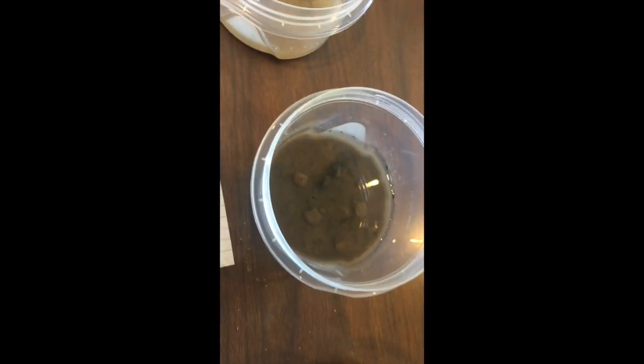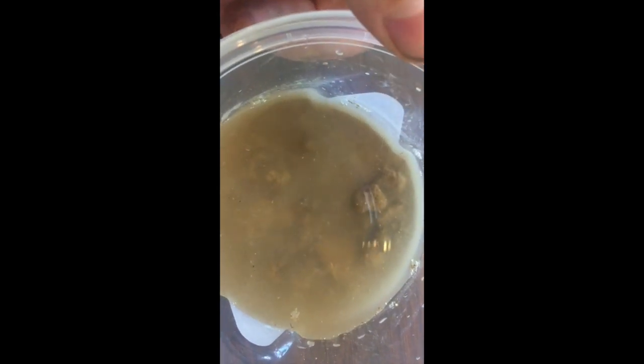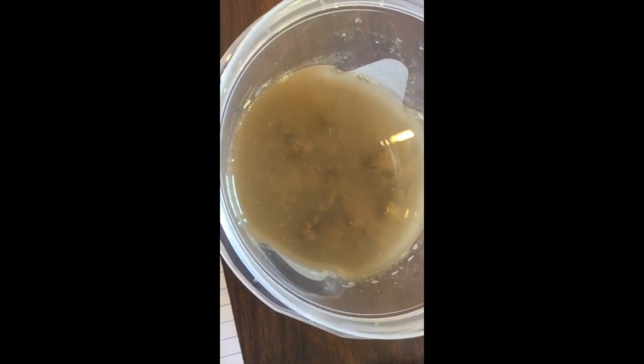Here we are again. It's been 20 hours since these samples were put into the water. I checked them at 2 hours and did see that there was some partial slaking going on. There's your subsoil, there's the surface soil, and your lighter is the field, your darker is the forest on both of them. And it's pretty well. There is slaking going on and dispersion, but it's only partial. There's a lot of big clumps still in there.